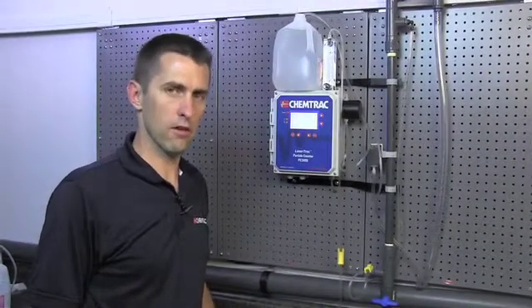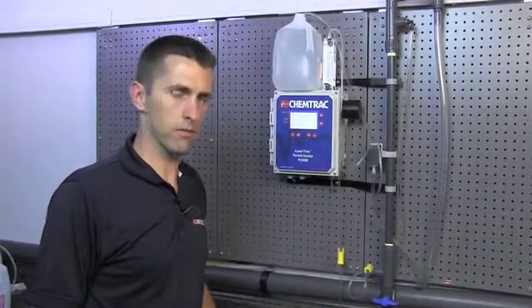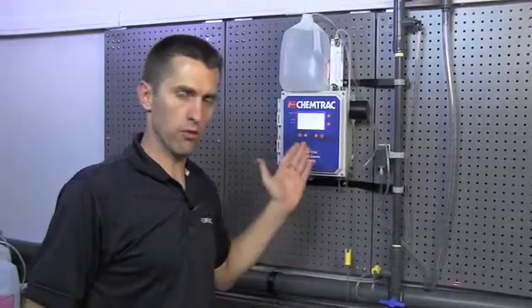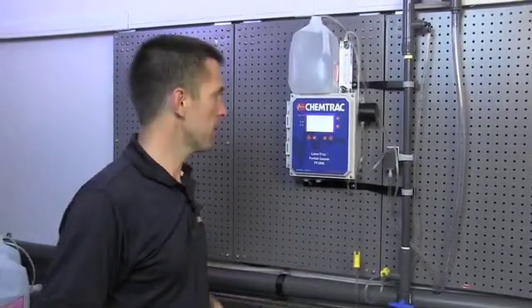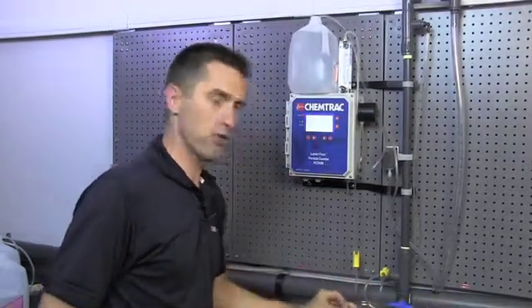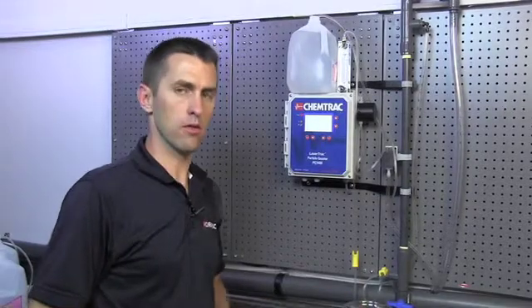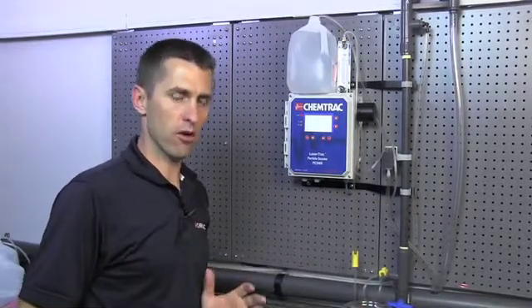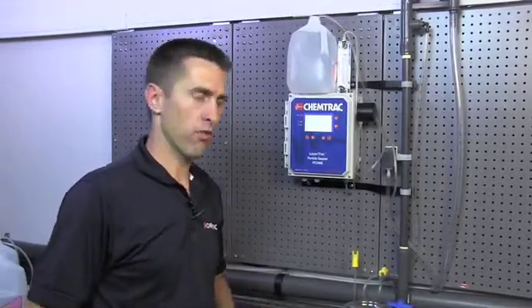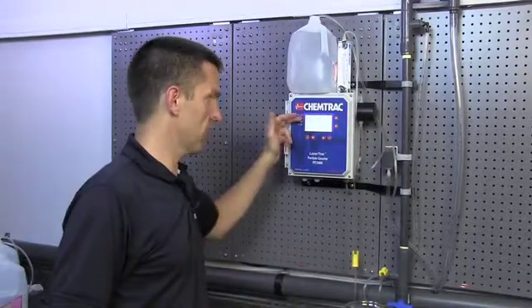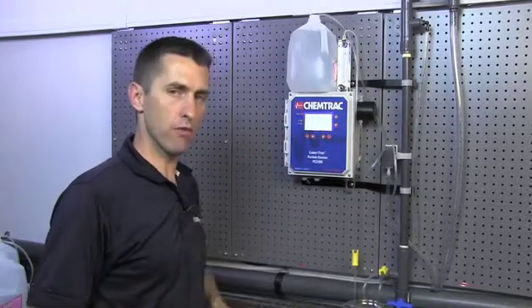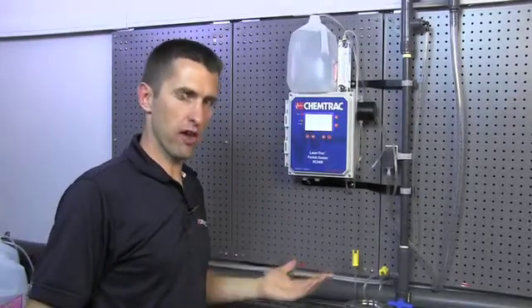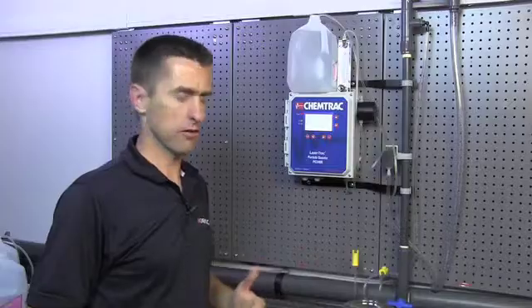So we went through the same process of preparing our 5 micron solution. Our background counts were very similar to what we had when we made a 2 micron solution. We're going to now start the flow and see what we get. We made a solution of 1,000 counts per milliliter of 5 micron particles. So as with the 2 micron, what we're expecting to see is half of those, 50%, be above 5 micron and the other half be below 5 micron. So, 500 counts in the 2 to 5 and 500 counts in the 5 to 10.